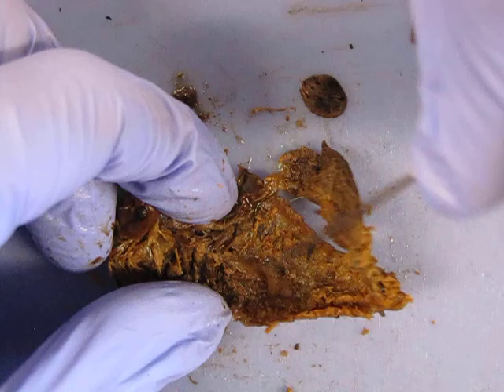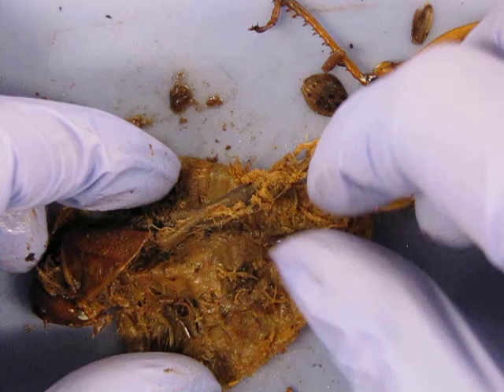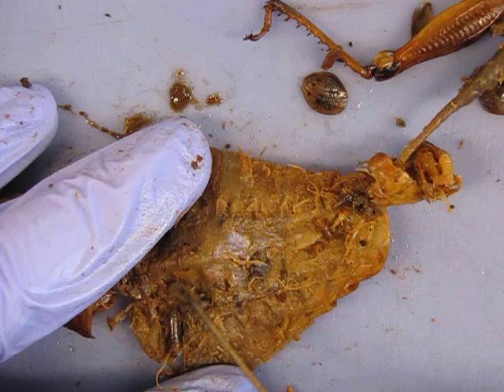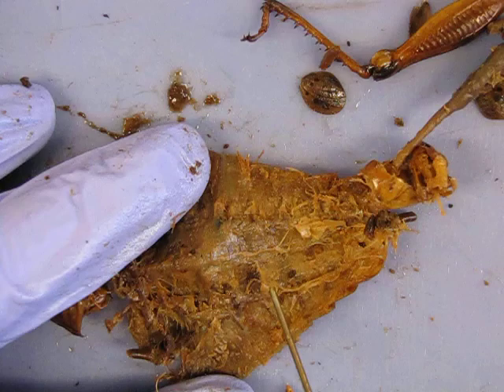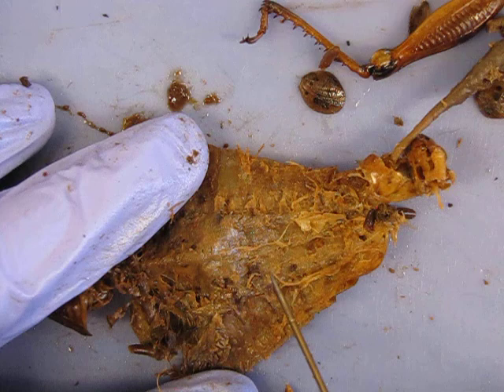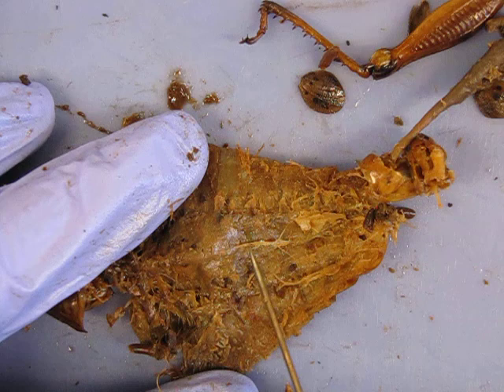I'm not seeing it on the male. Let's see if we can find it on the female. I'm going to remove her ovaries and digestive tract a bit. Oh — there's nerve cord right there. It's really easy to miss because it doesn't take much to pull something away. The nerve cord doesn't look all that different from the tubules here, so how do you know what's what? It's all about location — it comes ventral here, and you can see this very clear cord with little nodules. The ganglia, ganglia, nerve cord — notice the ganglia and then you can see where it branches out from there.